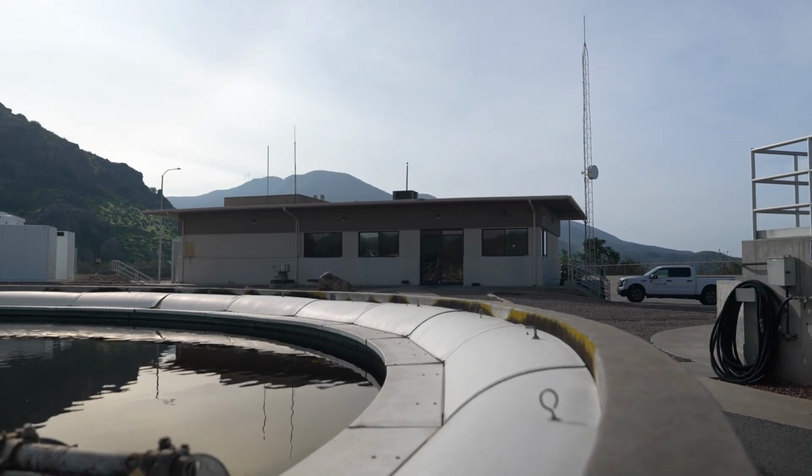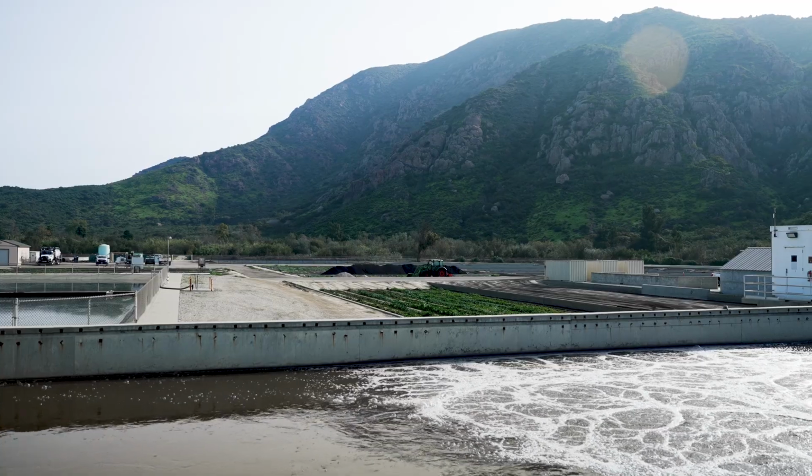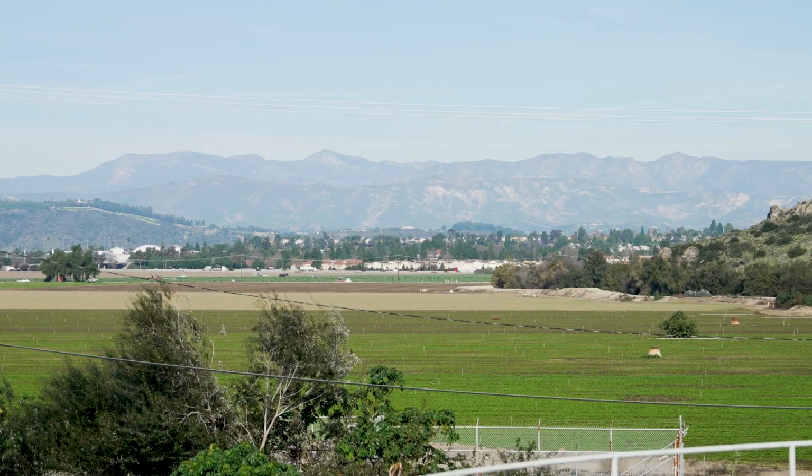We are here at the laboratory at the Camarillo Sanitary District, where we analyze the wastewater and recycle water for the city and residents of Camarillo. My name is Darren Carter, and I'm the Water Reclamation Superintendent for Camarillo Sanitary District. I'm here joined today by our chemist, Shane Doss, and our laboratory specialist, Eric Dean.